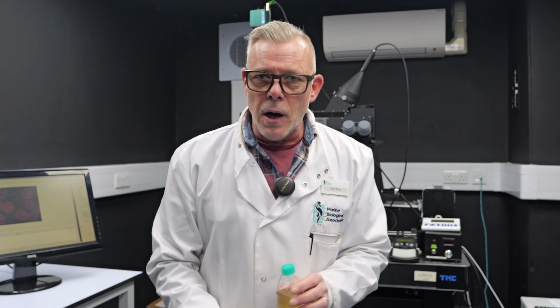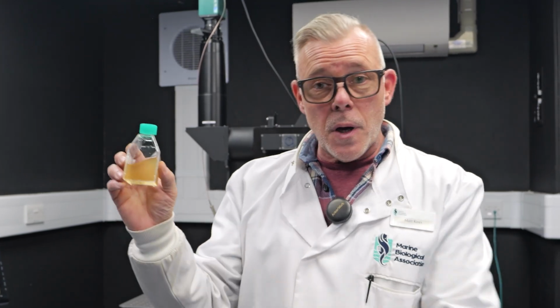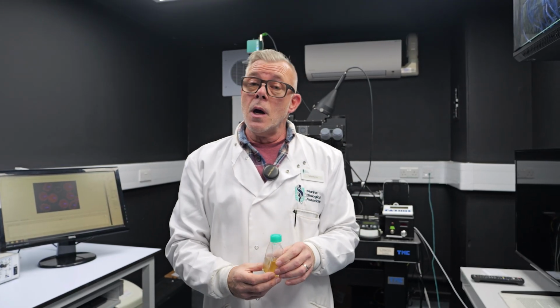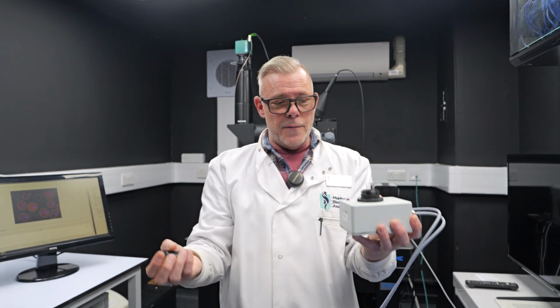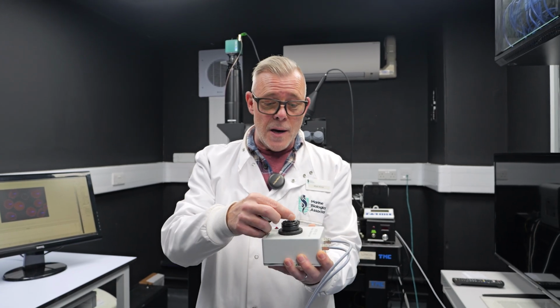So when we're measuring chlorophyll fluorescence, typically we can take algal cells, either from cultures that we grow in the laboratory or from natural seawater samples. And historically, we've measured chlorophyll in closed chamber systems. So we'll have a small detector unit like this that can detect chlorophyll fluorescence.